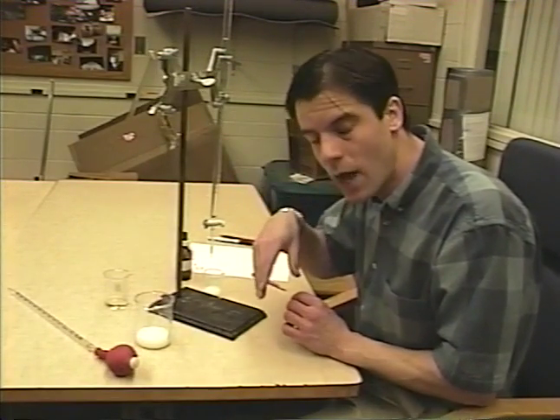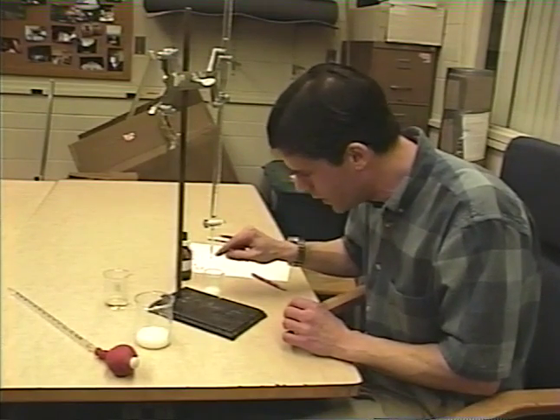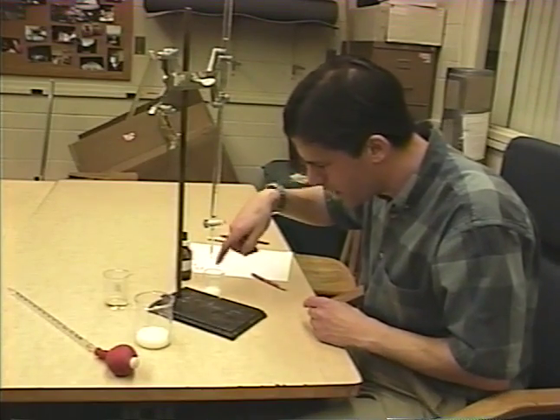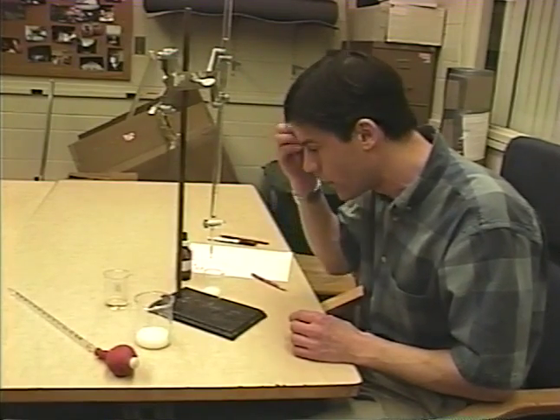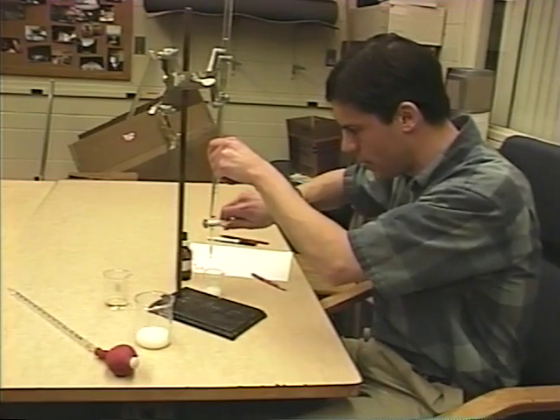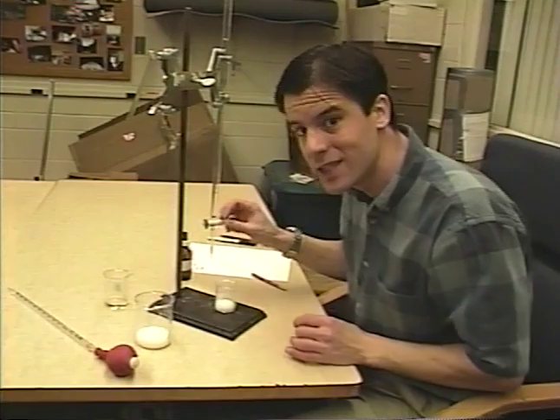How do you add drops? You need a steady hand — if you turn it on and try to turn it off quickly to get a drop, it's not going to happen. But if you turn it on slowly so the solution is just slowly coming out, you can let just one drop fall. You could also add less than a drop. I just turned it on barely so a little drained out and there's about half a drop hanging on the tip. You just take a bottle of distilled water, touch the tip to it, and the water will wash that half drop of base into the beaker — so you've added half a drop, making your data even more accurate near the endpoint. Another way to add less than a drop is to do a quick flip of the stopcock if you have a fast hand — that actually adds less than a drop of base.